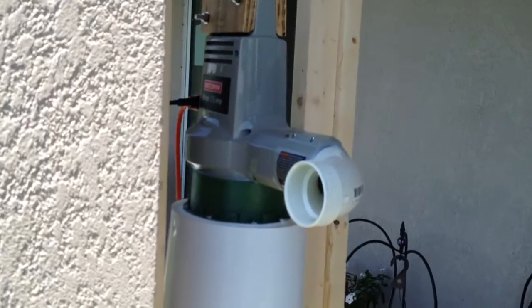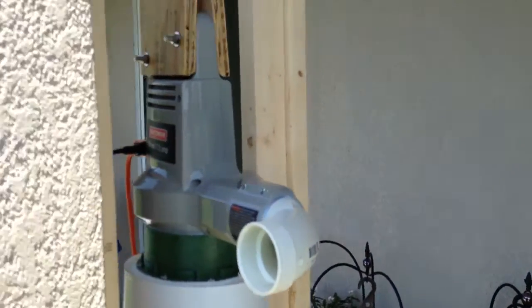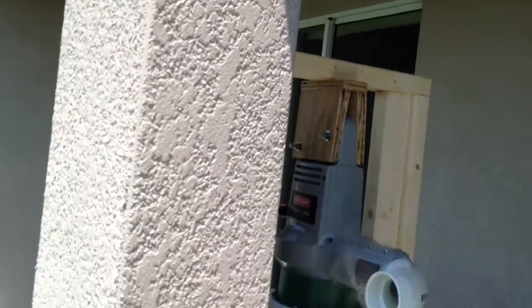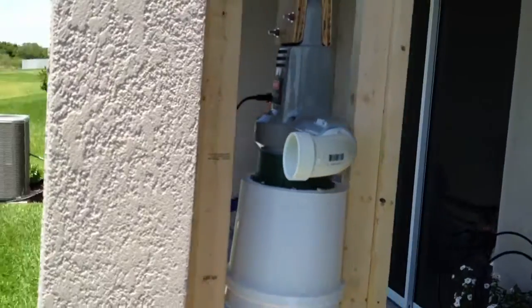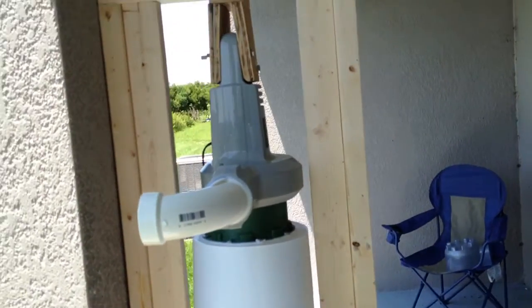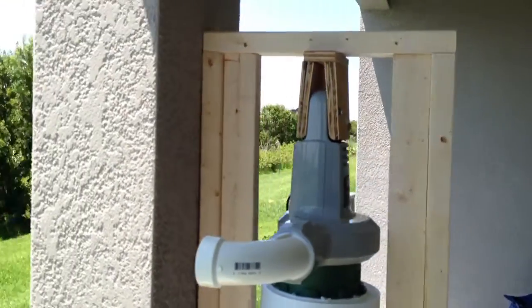And then lastly, I'm going to attach a flexible pipe onto the end of this and run it up about 10 feet up the side of my house. I'm just going to hold it in place with some rubber strapping so my wife doesn't kill me. That should keep the vapors way out there - they should go up about 10 or 12 feet in the air, maybe even further with the high power of the leaf blower.